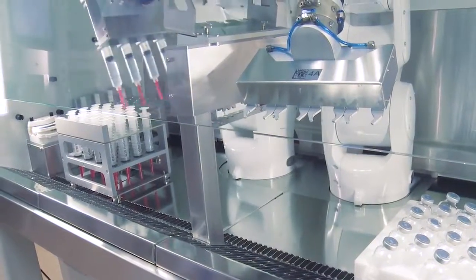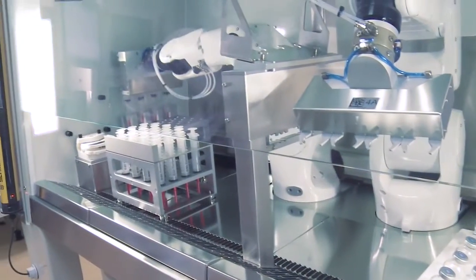Once all dose vials have been handled, the robot stops. Finally, the user lifts the tray and racks out of the cabinet for further processing.